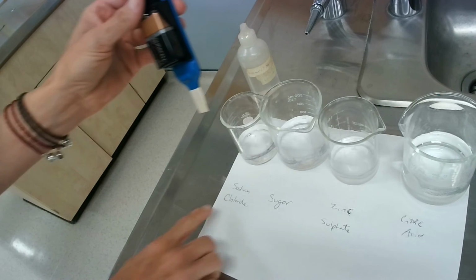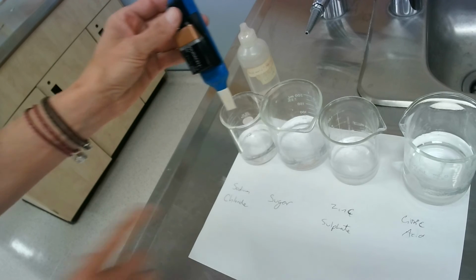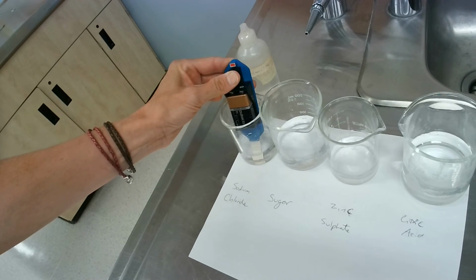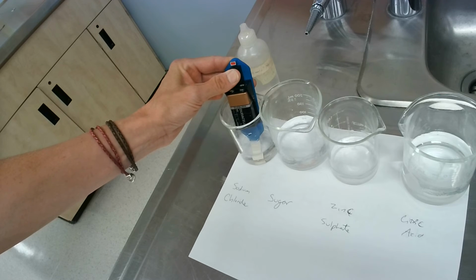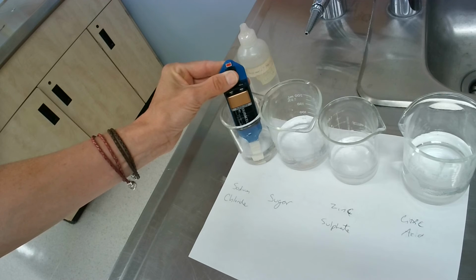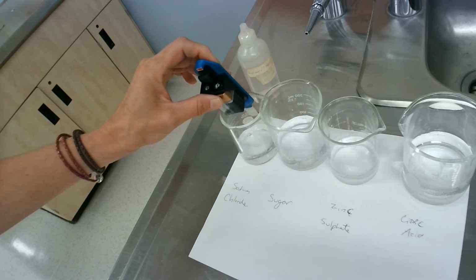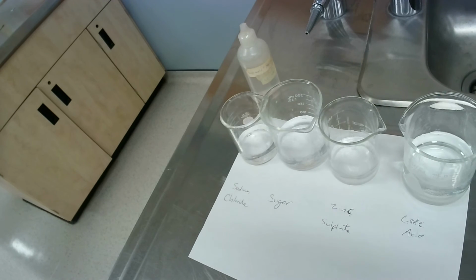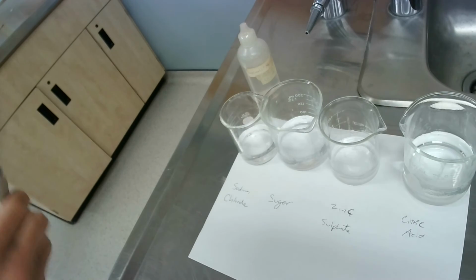Okay, so we're looking right now, first one we're going to look at, that's on your sheet, is sodium chloride. So put it in. Sometimes these lights, you got to hold it for a little bit. Sometimes it takes a little bit depending on, okay, so that one lit up, okay? So sodium chloride lit up. Let me just wipe off the bottom of this. I would have reminded you this if you were doing this in class, just so that you don't carry the solution to the next one.